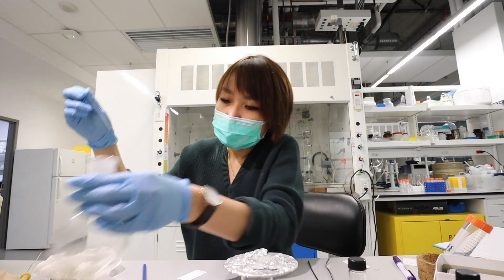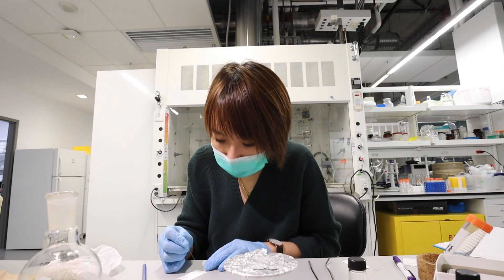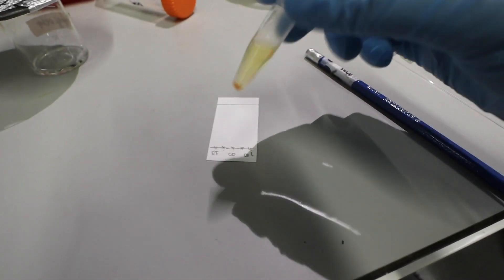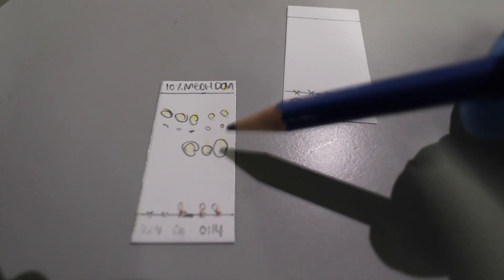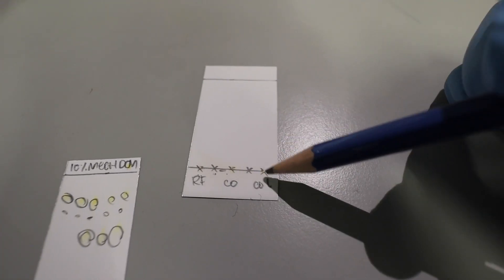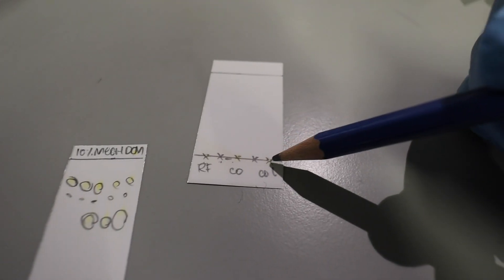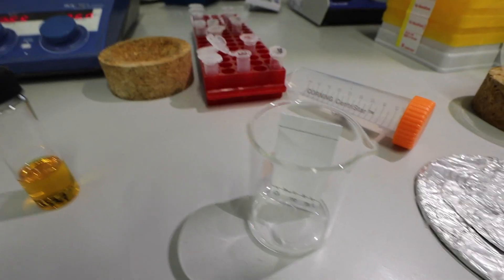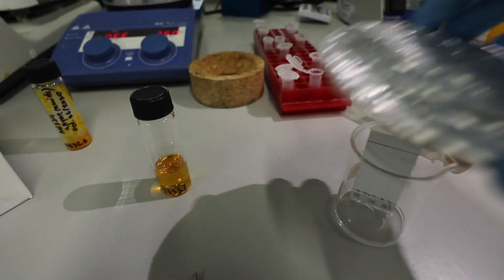So I usually spot like the reference compound. So I took an aliquot from the silica slurry before columning, which I also have here. Remember this? This is the reference, has three kind of things, four kind of things. Co-spot with the columned compound, so like the pure supposedly pure compound and then the column compound by itself. So that way I can check to make sure that I isolated the right fraction. So this is a mixture of 10% methanol in DCM and I should run and do its thing.